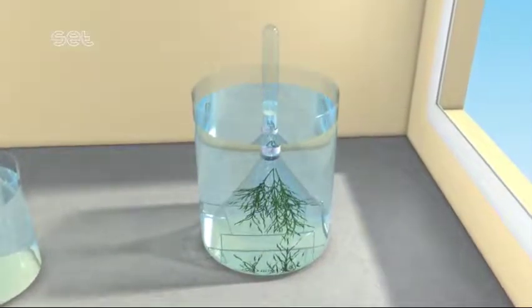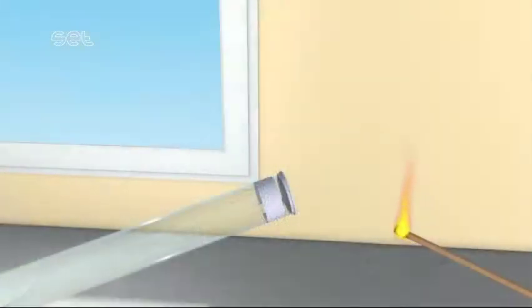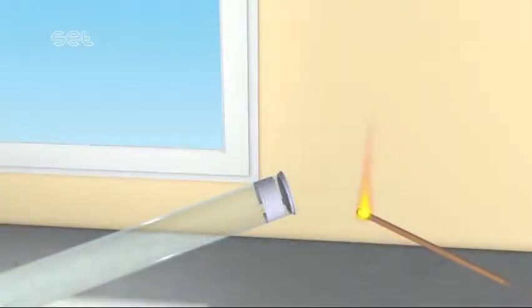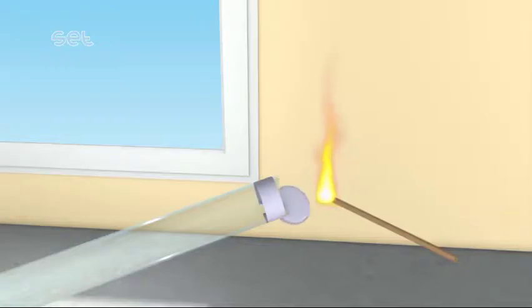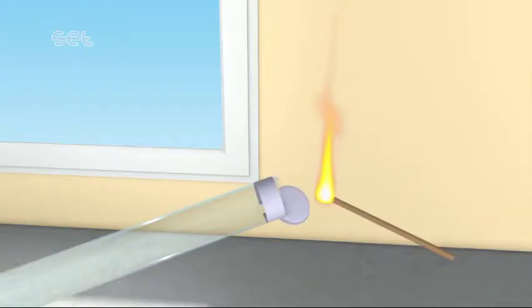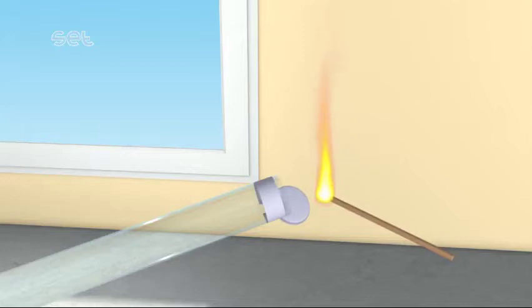In order to observe that the collected gas is oxygen, a burning match is brought near the test tube. The expansion of the flame shows that the collected gas is oxygen.